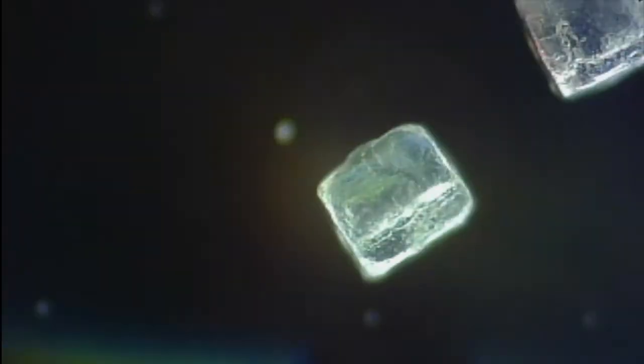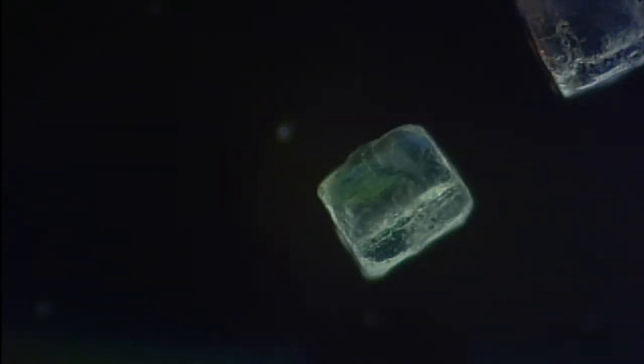We'll see. Anyway, so salt crystals. This is just a quick tour for myself, mostly for proving or disproving the system. Okay, at the lowest power here I have to use dark field because of the way I got it set up. Now I can tear it all down, but let me show you what it looks like when it's torn down and it's running just as a microscope. As a normal microscope should.